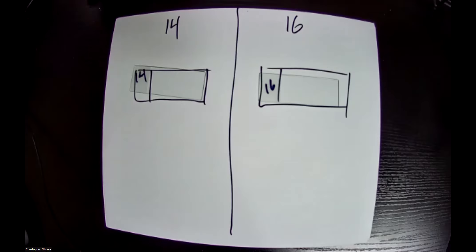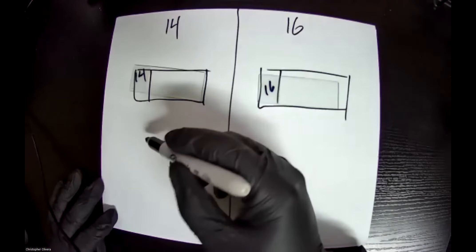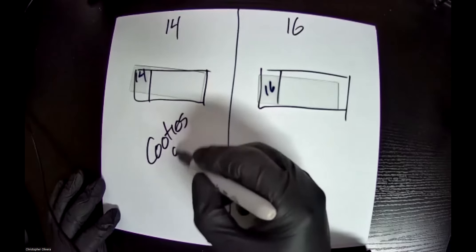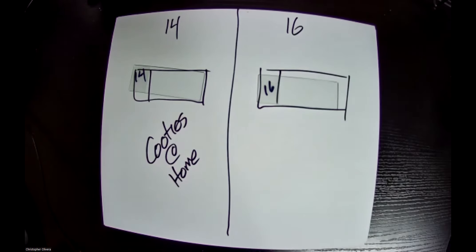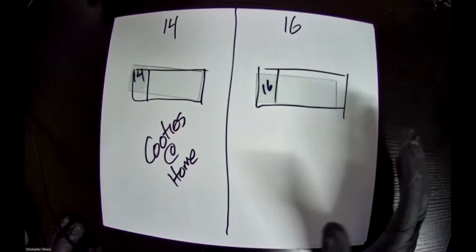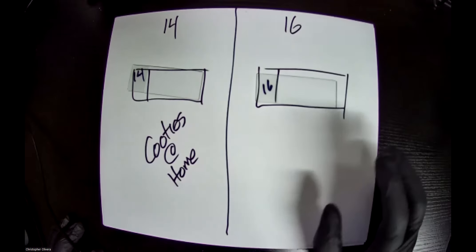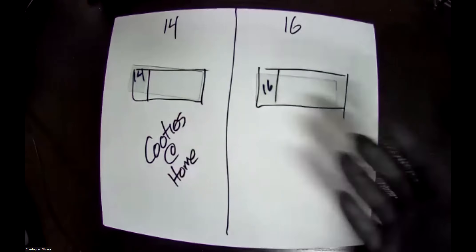When we're in the actual lab in person, we end up having to write a lot more because lots of people are doing this. But here's my setup: normally we would write what organism we're using — in this case we're using cooties from home. Your slides need to be clean; powder will do the better job of polishing it, but any cleanser will do. Just make sure you rinse really well because any little bit of soap will disrupt your stain.